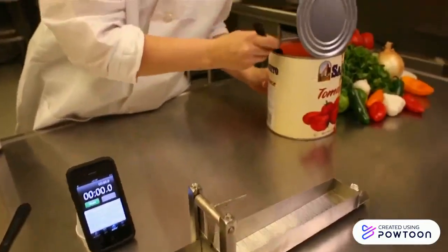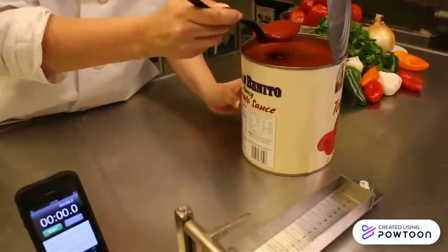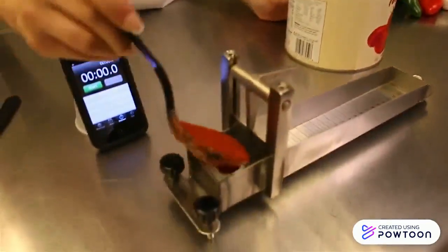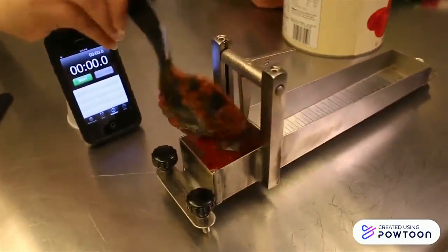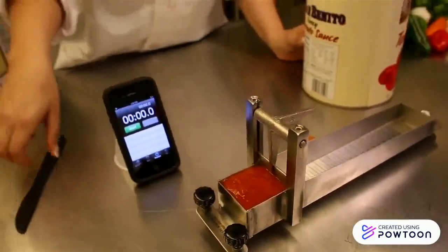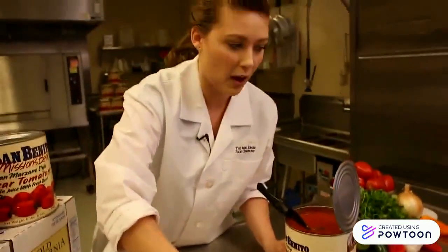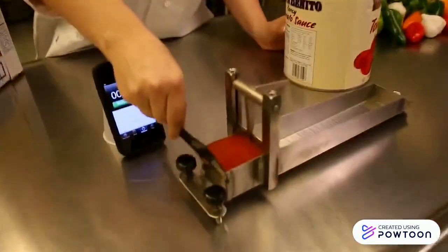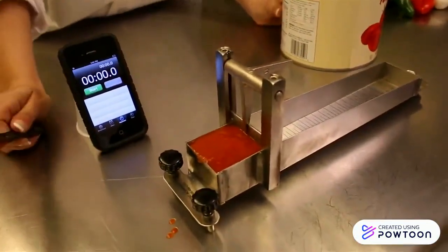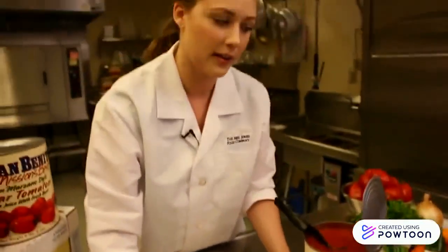You're going to fill the reservoir up to the top with the product being tested. Don't forget to level off the top. Make sure that the chamber is full and contains no air pockets.